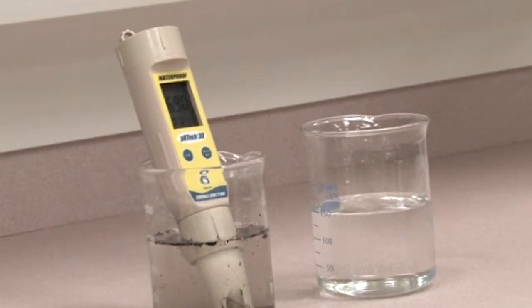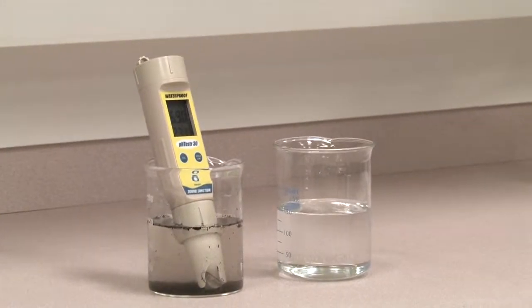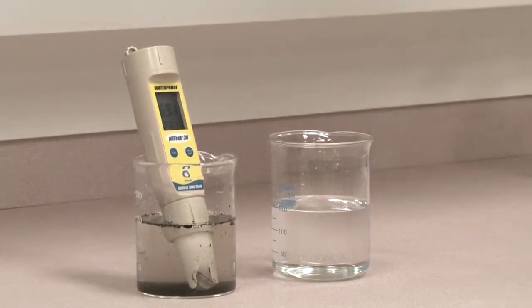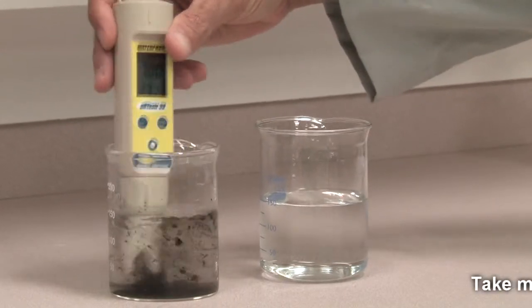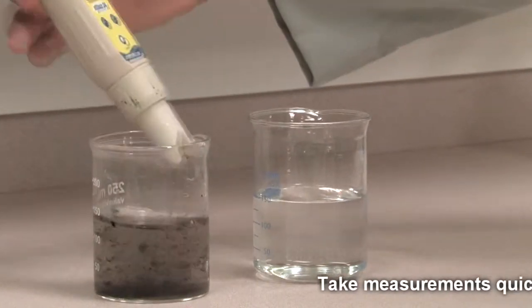Getting the best performance and maximum life out of your Oakton pH tester may require maintaining the electrode. Depending on the type of sample you are working with, Oakton's technical experts recommend the following.